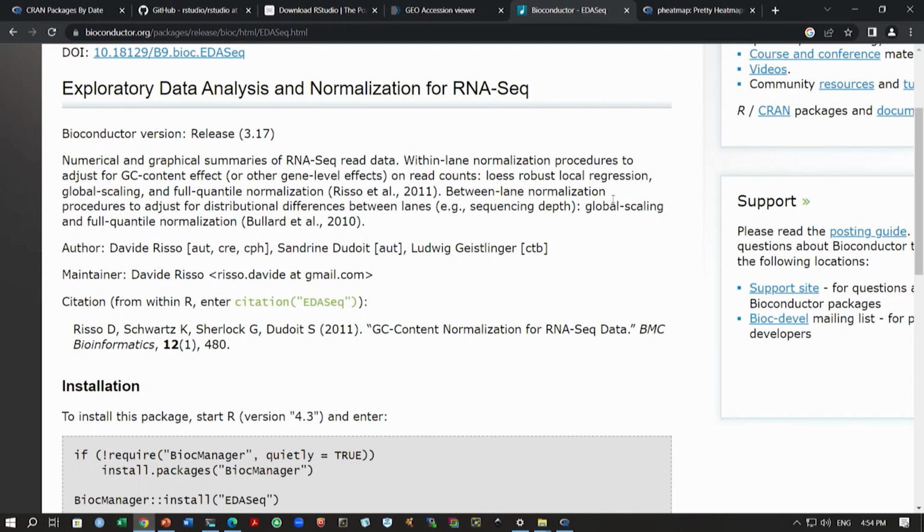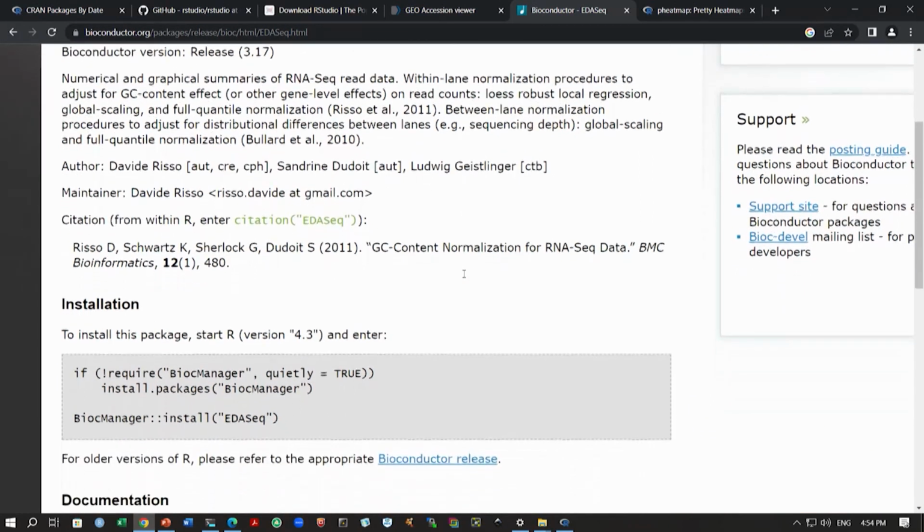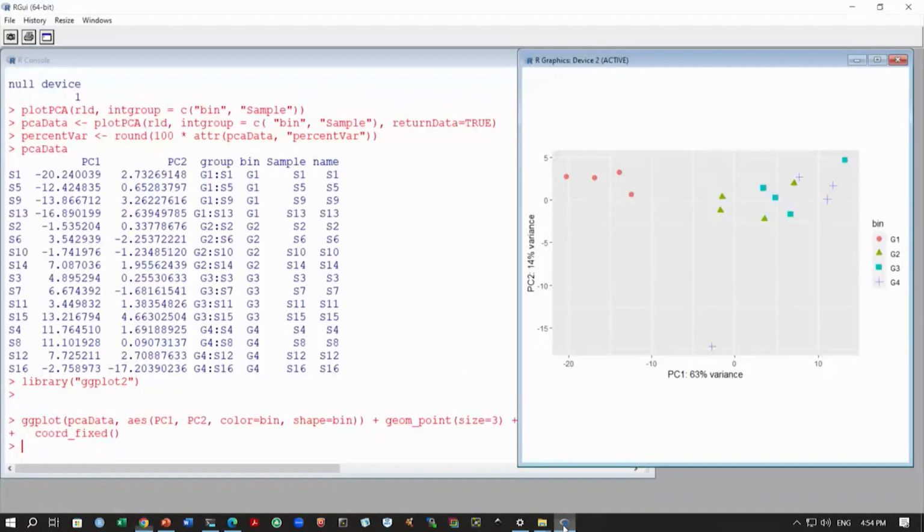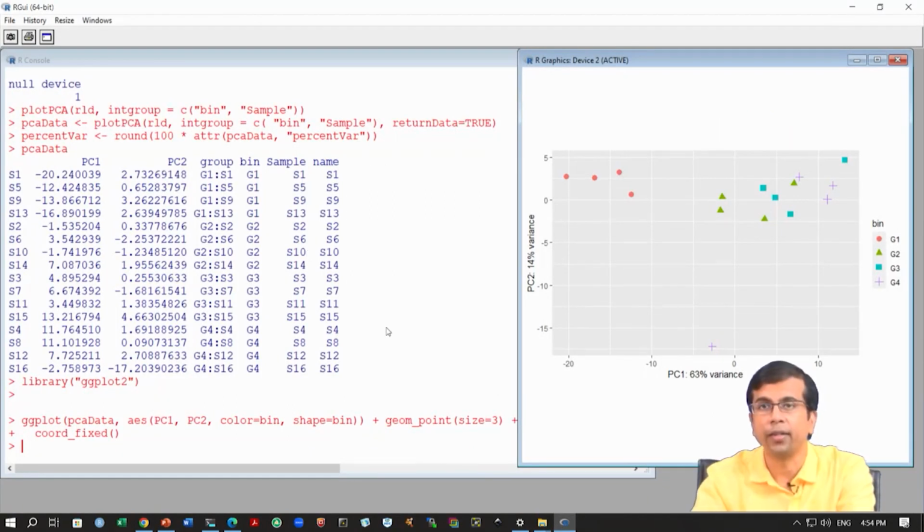It can do a lowess regression, global scaling, or full quantile normalization, and it can also do between-lane normalization, meaning between-sample normalization. We'll just take the within-lane normalization, because we want to correct for the biases. These are sample-specific biases which we can correct through the within-lane normalization. So this is what we are going to do. We'll try with the GC content normalization, and we'll first have to install this package. Let's see if it is there or not, and if it is not there, we can try to install it, and then we'll run the codes to correct the data.